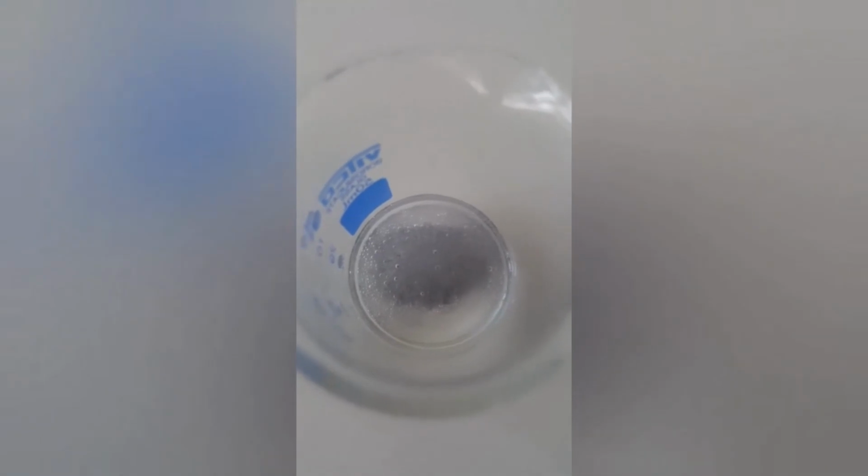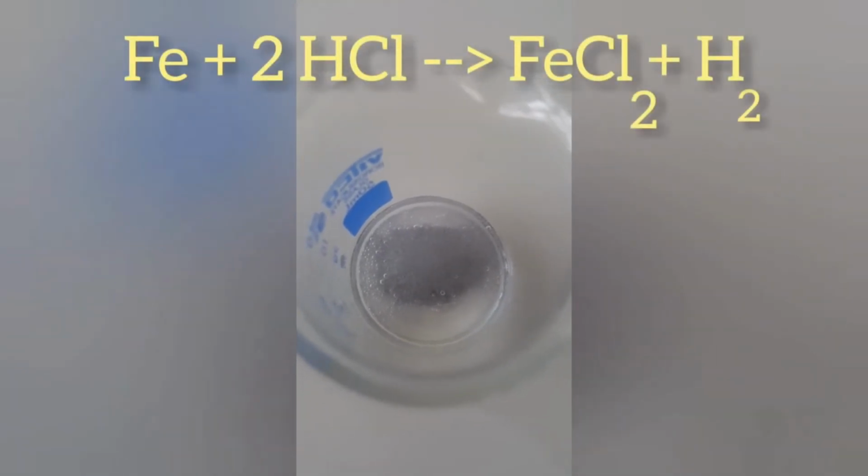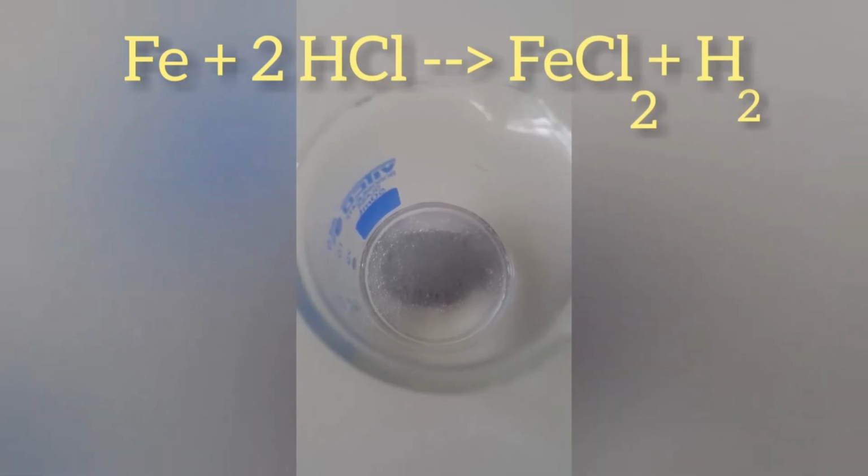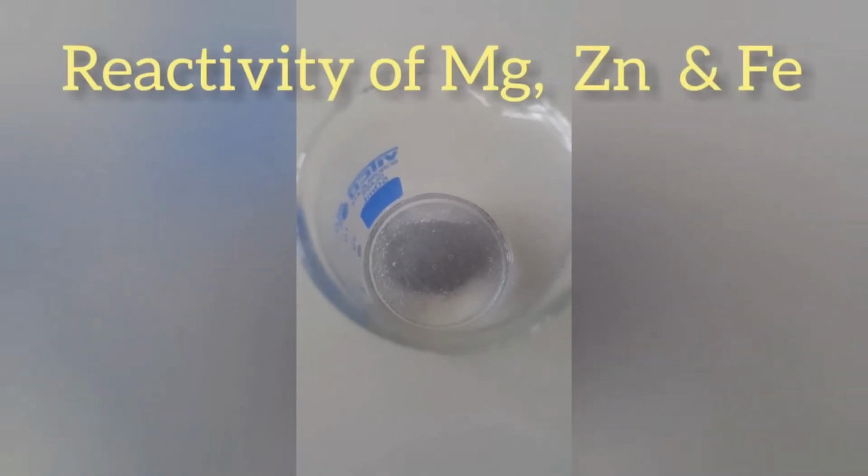Finally, this is iron powder. Iron actually we have taken in the form of powder. That's why you can see the bubbles are formed. But actually the reaction is less vigorous than zinc and magnesium.